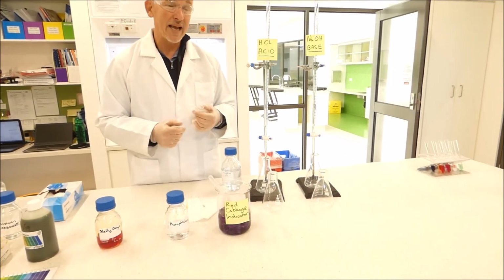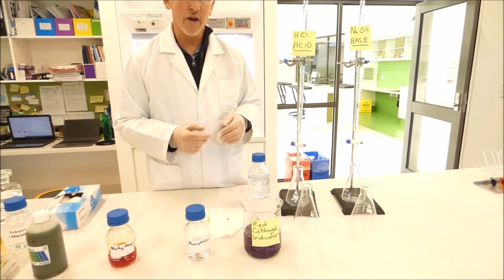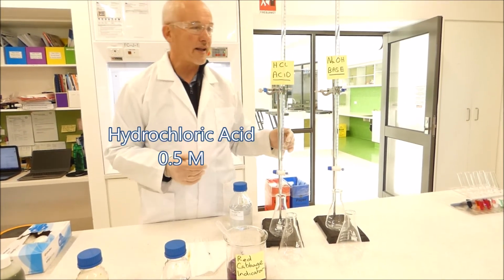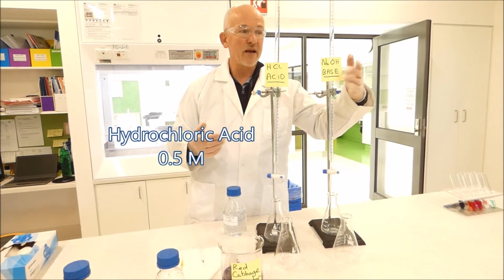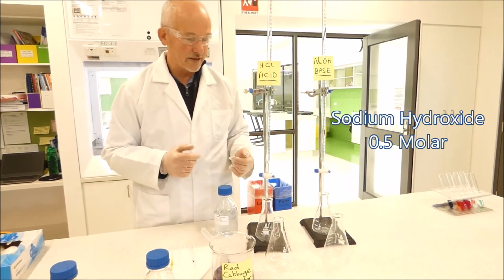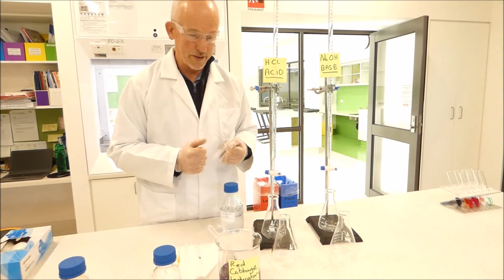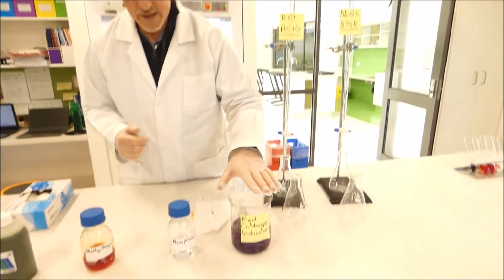If you do chemistry in later years, you'll be using burettes quite a bit. For our burettes today, we've filled one with hydrochloric acid, which is an acid obviously, and one with sodium hydroxide, which is a base. We're going to be using that for showing various properties of the indicators in a little bit. Other than that, we're going to be using four main indicators.